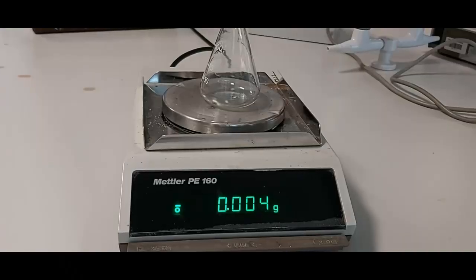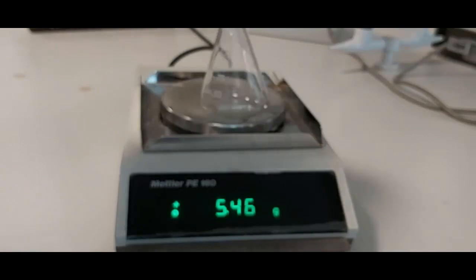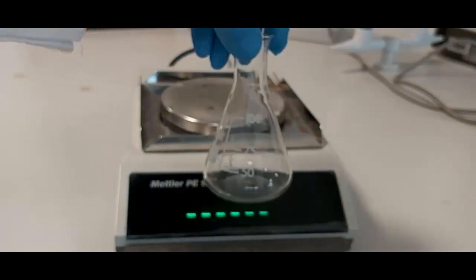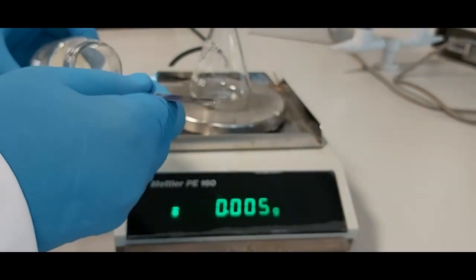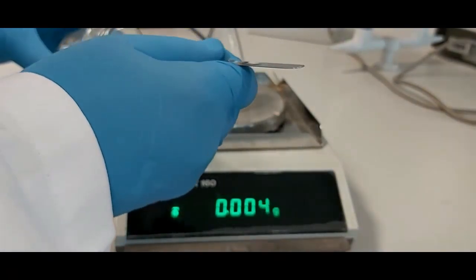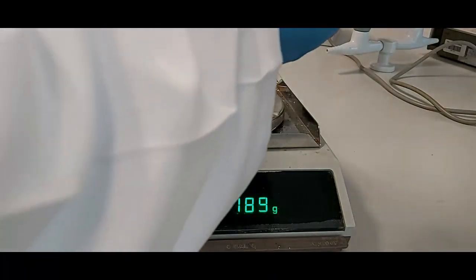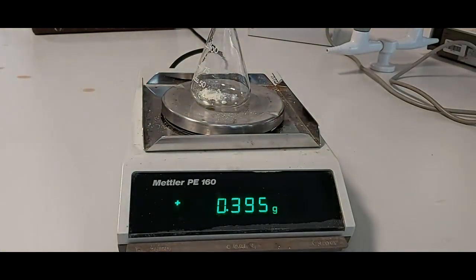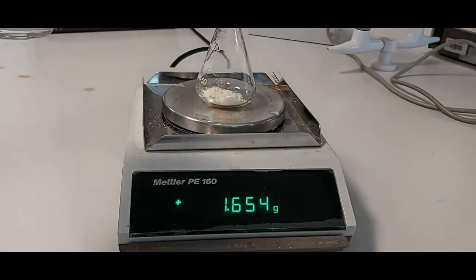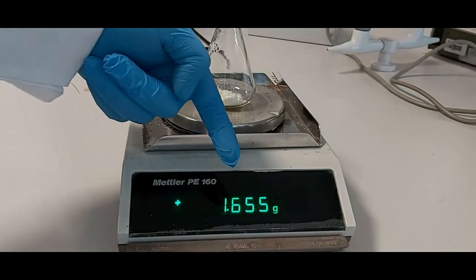First of all we start weighing the nitroacetophenone. We will take 1.65 grams and put it in the Erlenmeyer flask. I have 1.65 grams as you can see on the balance.